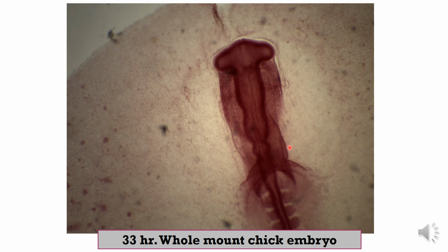Neuromeres, and this is the heart tube, formed from anterior to posterior by the bulbus cordis, ventricle, atrium, and two horns of the sinus venosus.